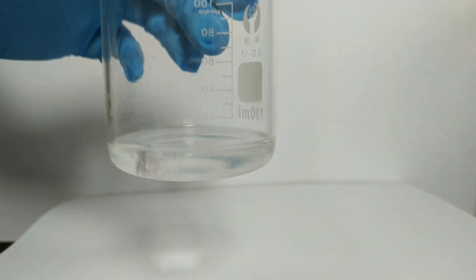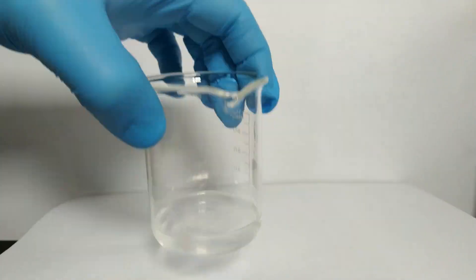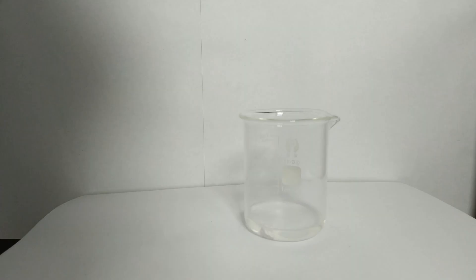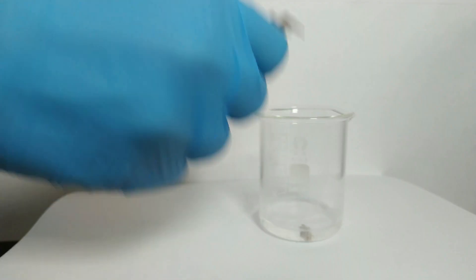Up close we can see a lot of small bubbles of hydrogen rising. Now we take a closer look at the sodium after some time in the ethanol. The surface is completely silver and freed from the layers of contamination, until you take the piece out of the ethanol. Then it turns slightly brownish as we can see, but this disappears almost immediately after putting it back in the ethanol.